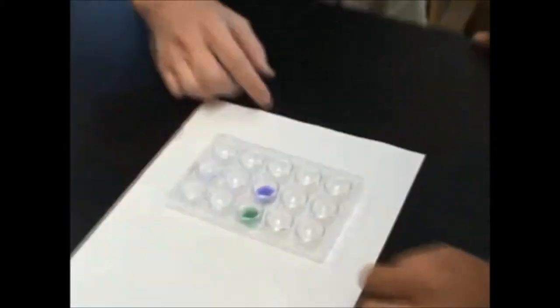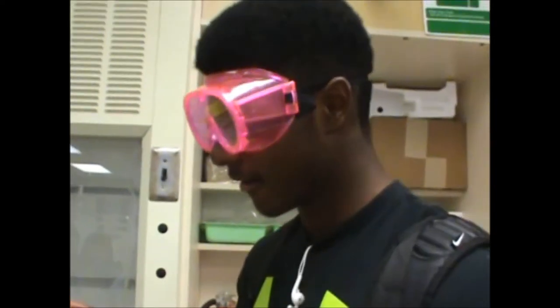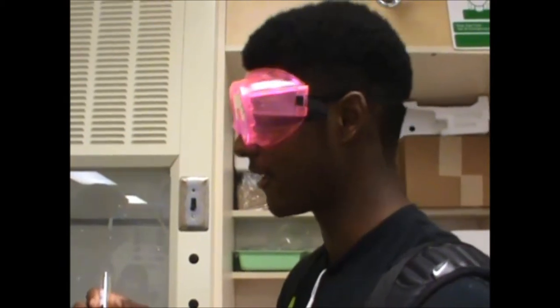These two the same? Mr. Miles, I ran a thiosulfate test and a sulfide test, but my thiosulfate worked, but my sulfide didn't. So I did this sulfate test and nothing formed. Does that mean it's not a sulfate or?